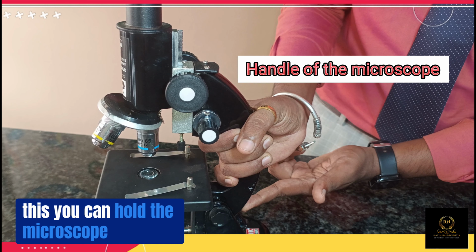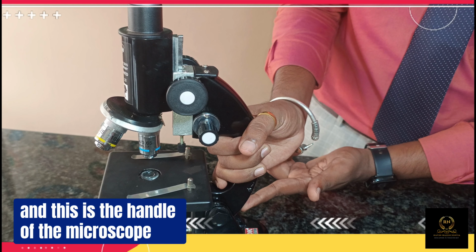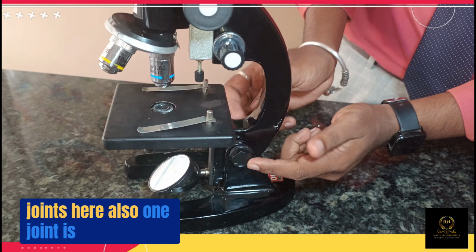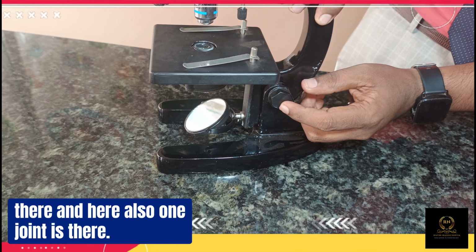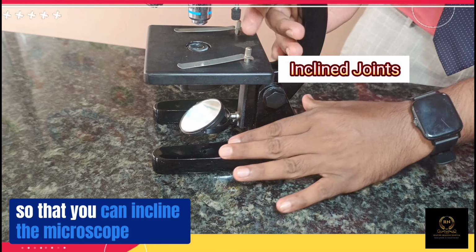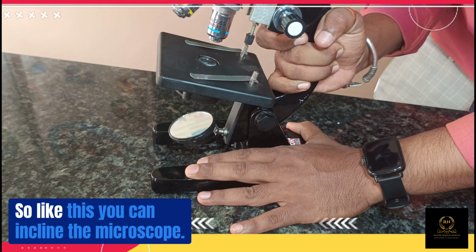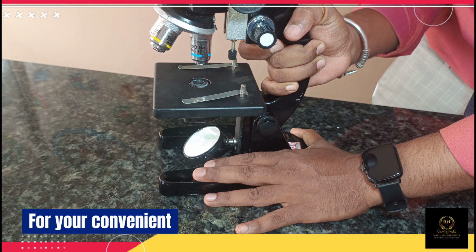Like this you can hold the microscope. And these joints, here is one joint and here is another joint. These are inclination joints, so that you can incline the microscope according to your height, for your convenience.